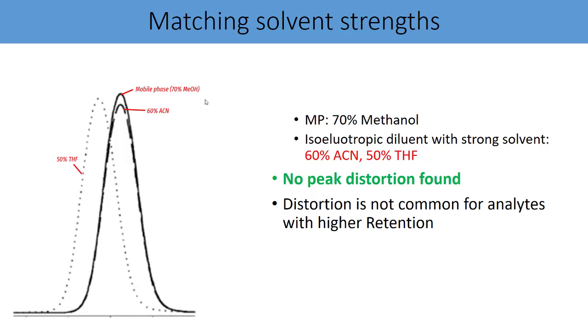Now when you run the chromatography with mobile phase that is 70% methanol, you also use your mobile phase, that is 70% methanol, as a diluent. See the peak on the screen. Now there is another peak with the dark dotted line, in case your mobile phase is 70% methanol but your sample diluent is 60% ACN.